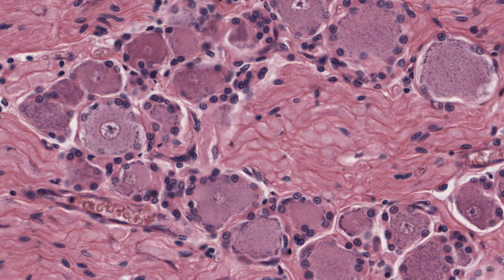The abundant small dark stained cells are satellite cells, and they form a sheath one cell deep around each ganglion cell body. The ganglion obviously has to have nerve fibres or axons running through it, going to and from the neuron cell bodies. These axons tend to clump together, and the cell bodies do likewise.